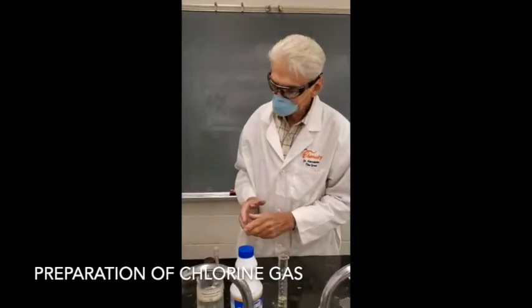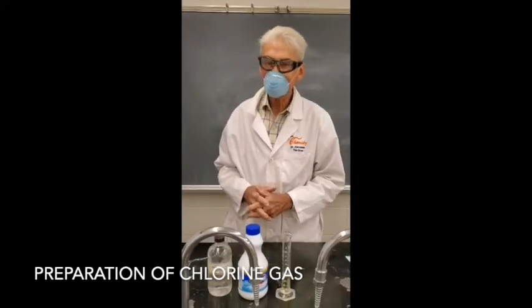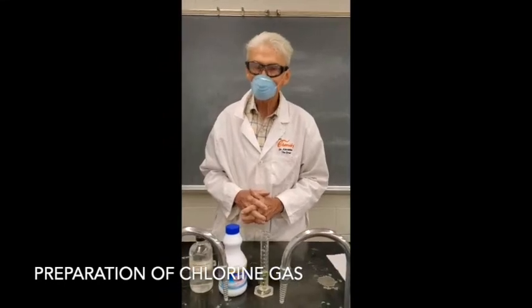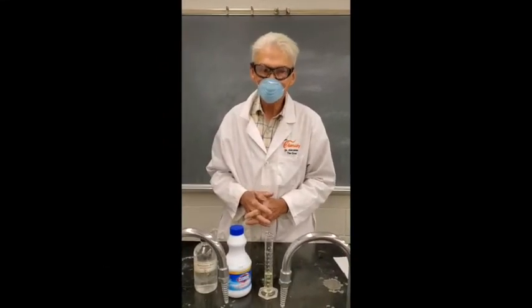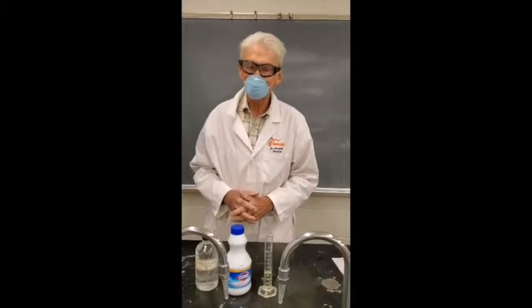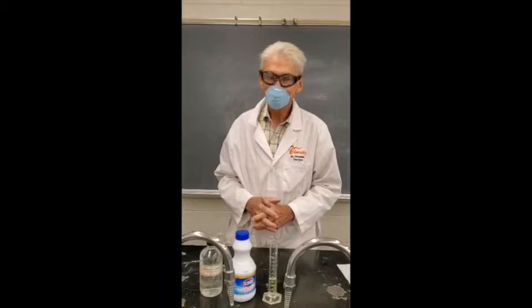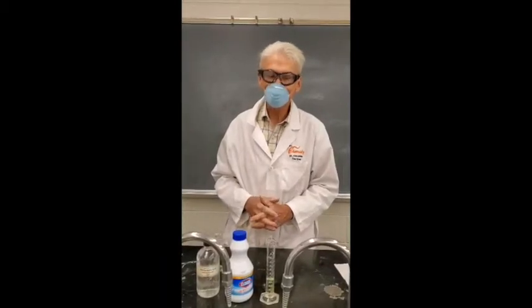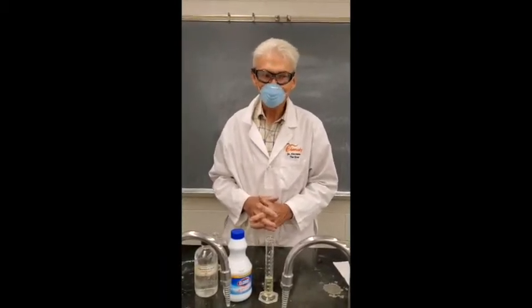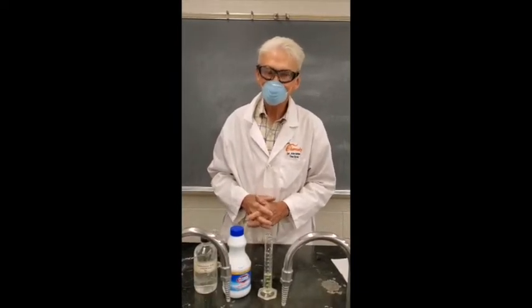Good morning, everybody. We're getting ready to do experiment number 8, which deals with the halogens, the elements of group 17 in the periodic table. Those are all non-metallic elements, and they're the most chemically active of all the non-metallic elements. And fluorine itself is the most chemically active of all the elements. It's so chemically active that water will even burn in fluorine.